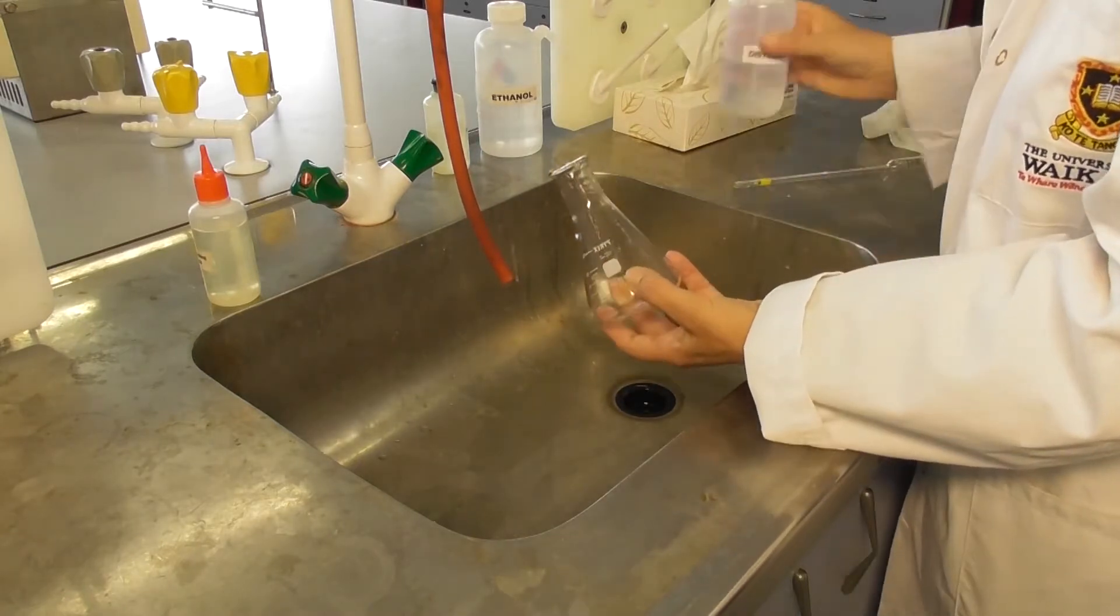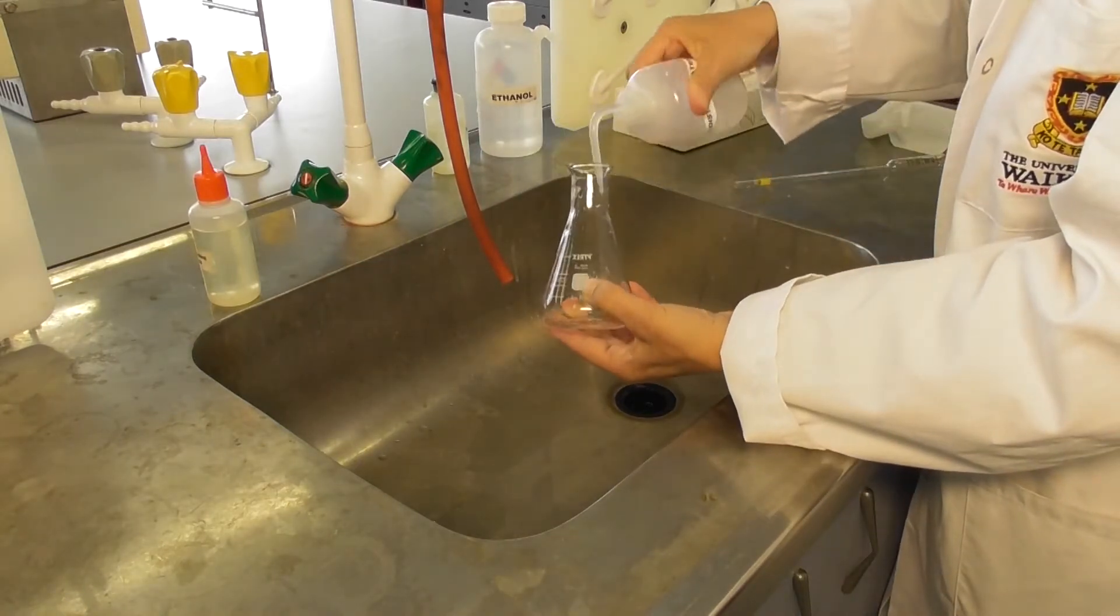Rinse flasks and beakers with tap water first, then a few times with distilled water from a wash bottle.